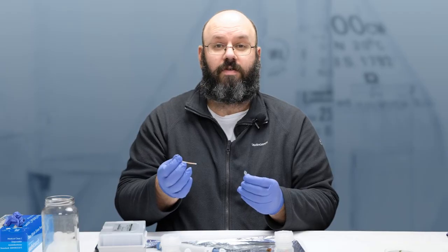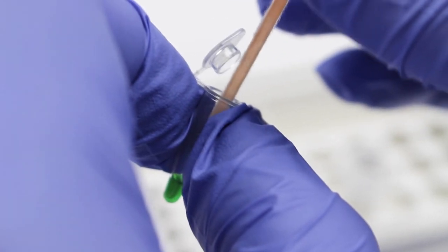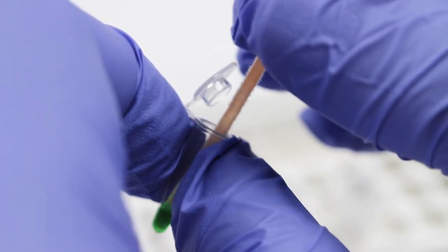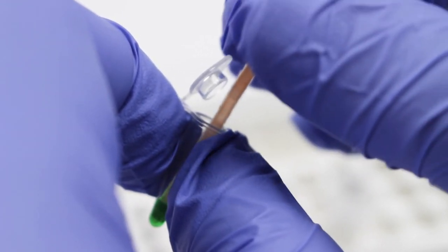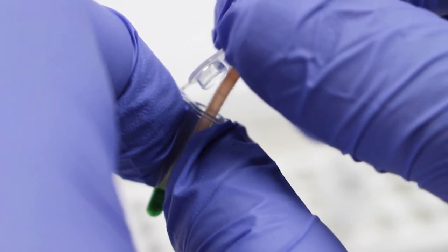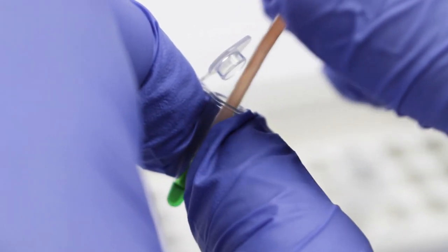Now we release the DNA into our PCR solution. Dip the dipstick into the PCR reaction mixture between three and 15 times, depending on how concentrated your sample is. Push the dipstick into the bottom of the tube so that the dipstick bends. This helps the liquid move through the paper and helps increase the amount of DNA released.